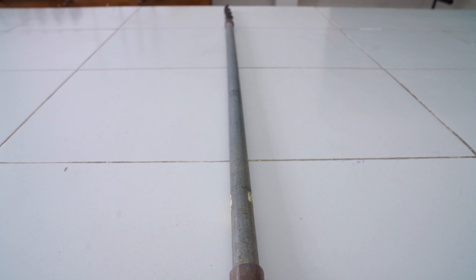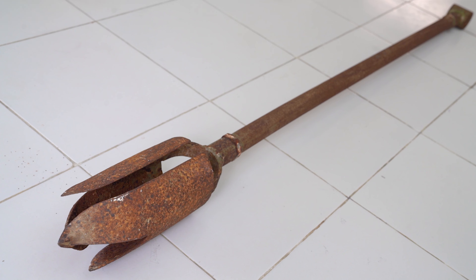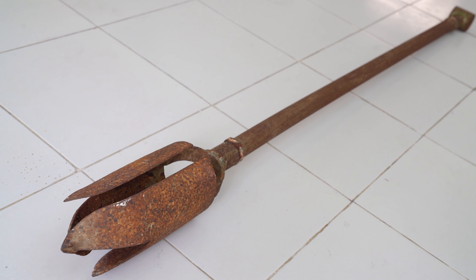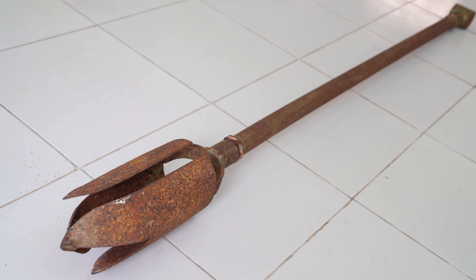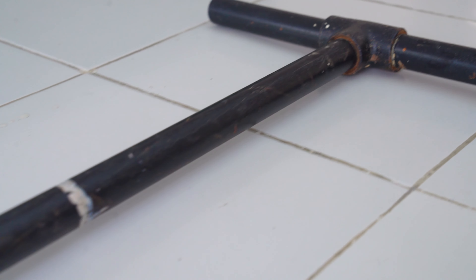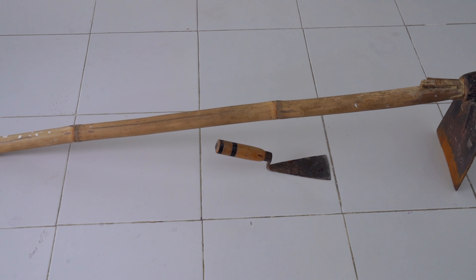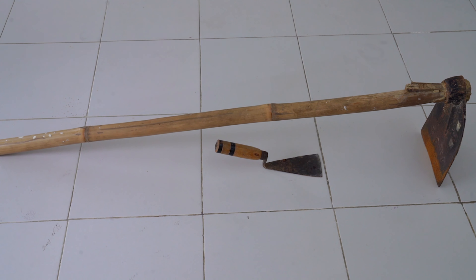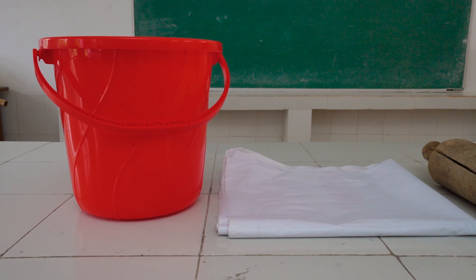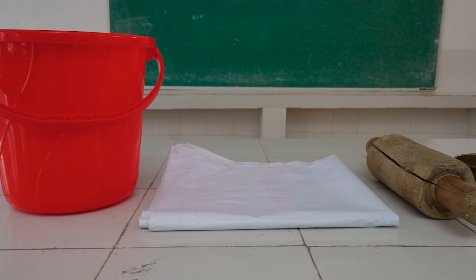For collection of soil samples, first we need a soil sampling tube or augers. Various types of augers are available and used in different conditions. The screw auger is suitable for gravelly or stony soils. The barrel auger is suitable for loose or sandy soils and compact soils. The Dutch auger is suitable for wet or moist soils of moderately fine or fine texture. If augers are not available, a garden spade or kurpi can also be used effectively.